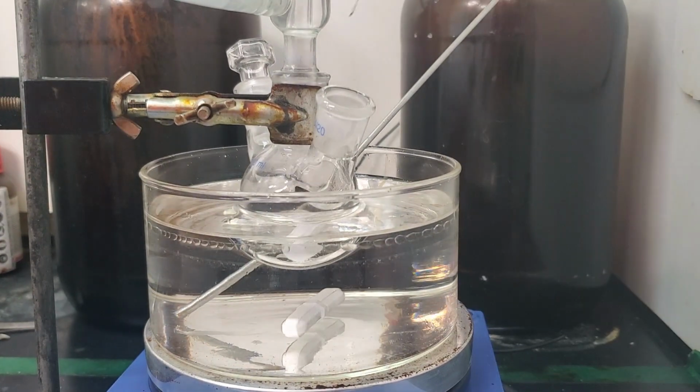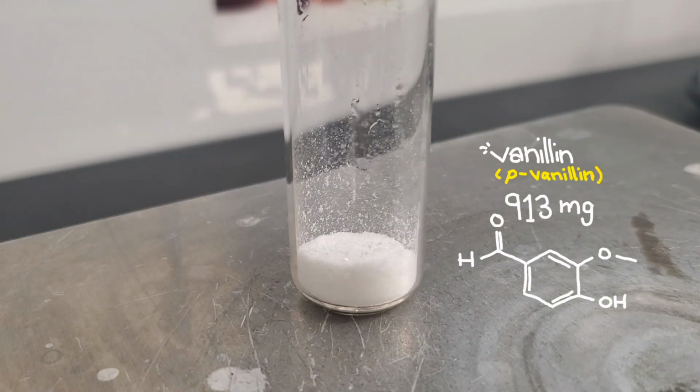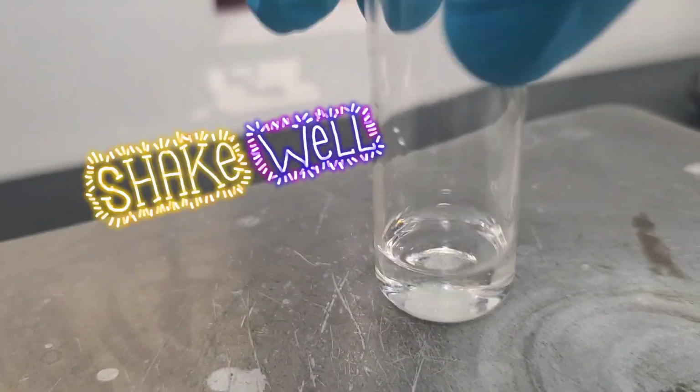vanillin. To help it go in smoothly, I first dissolve the vanillin in a minimum amount of acetone, then add it dropwise with a Pasteur pipette so the reaction stays controlled.